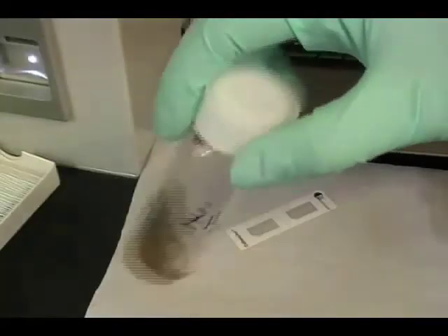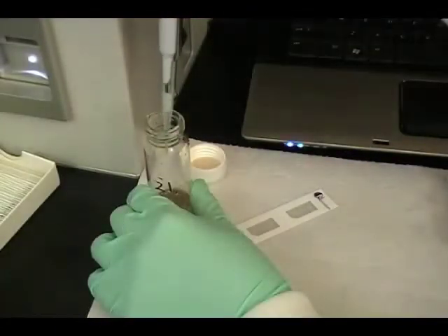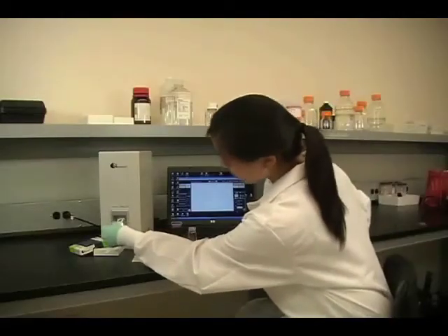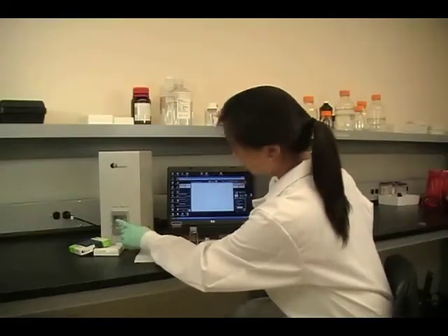Stir sample well. 20 microliters of cell sample is loaded into a Cellometer counting chamber, which is inserted into the AutoX4 instrument.